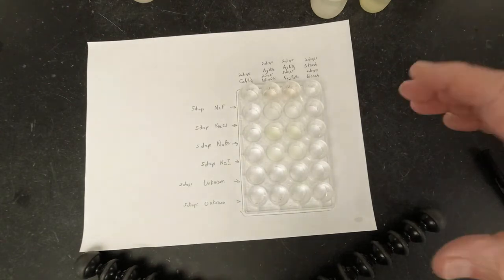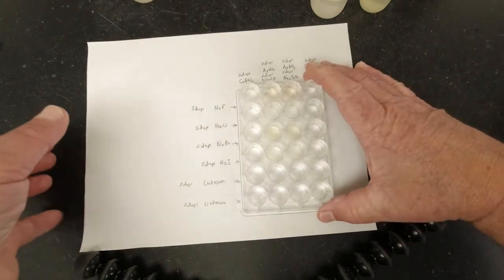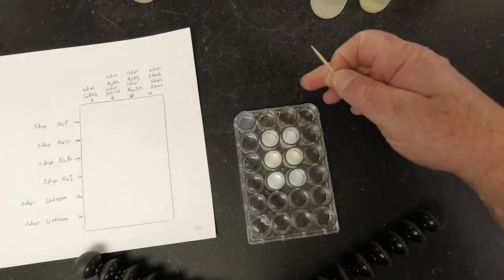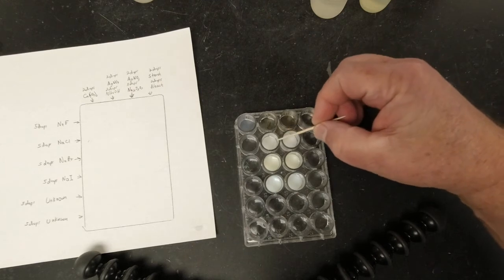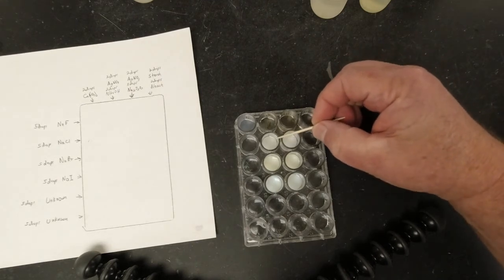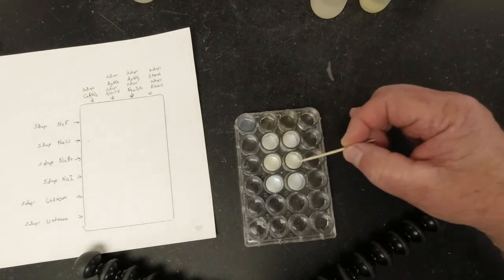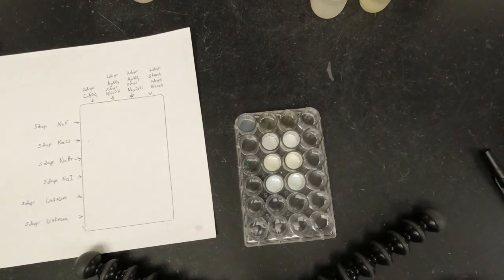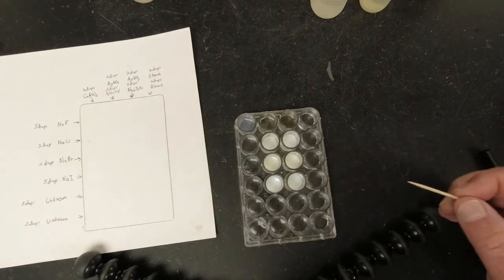All right, so now if I look at that from before, we can compare it to the one next to it. I don't know if you can tell or not, but when I put those 2 drops in there, this one seemed to fade a little bit. All right, this one, if I look at it, didn't seem to change very much at all. And then down here, that one didn't change either.